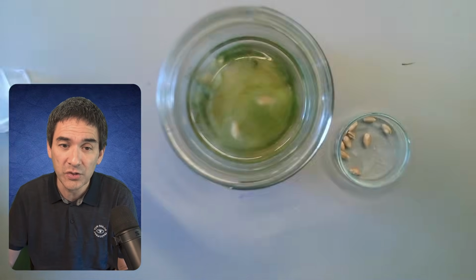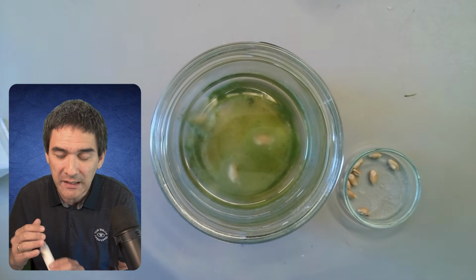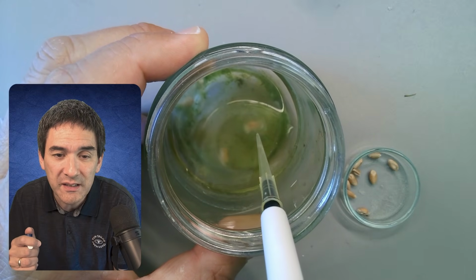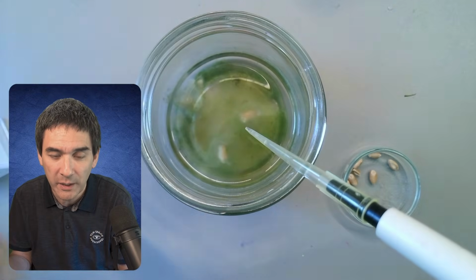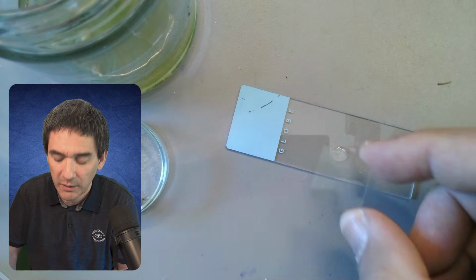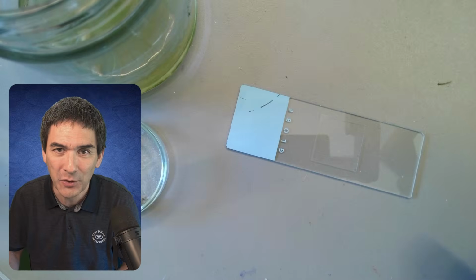It's not only going to start to decompose, but it will also start to form a slimy layer around it. And what I've done therefore is I've taken a pipette and tried to take some of this slimy stuff here, and that's basically what I put under the microscope. We can try it now as well. The wheat grain, of course, acts as a food source for the bacteria. So cover glass on top, and now under the microscope.